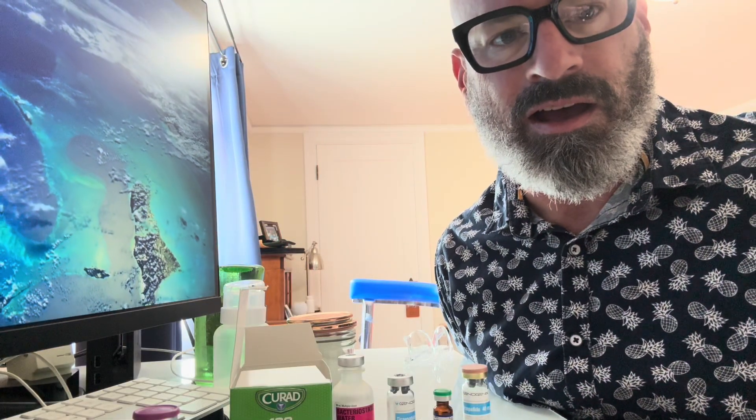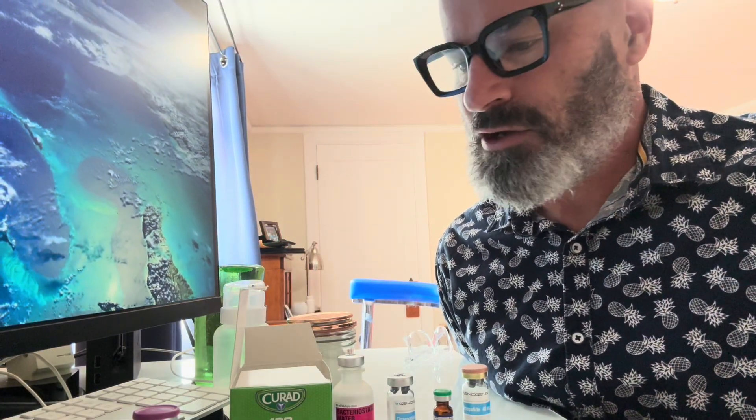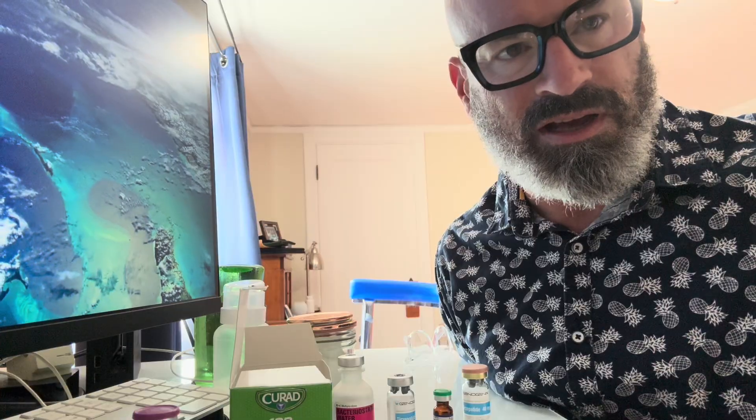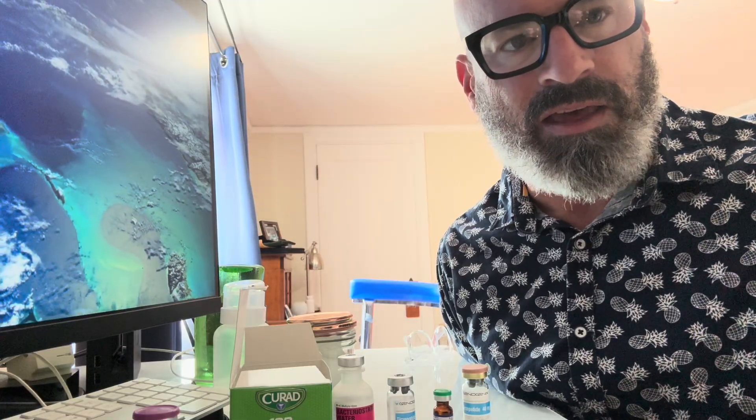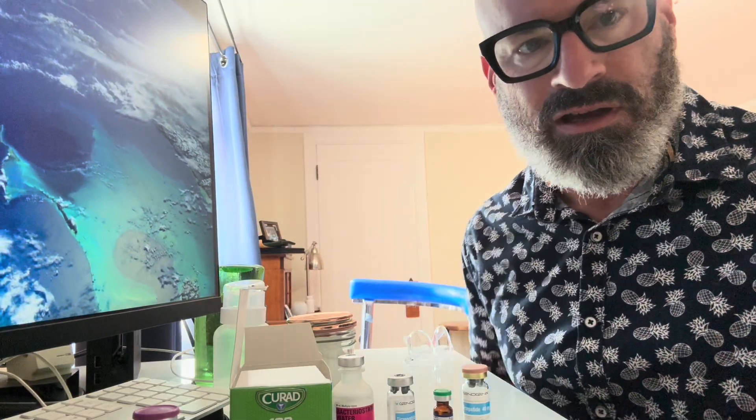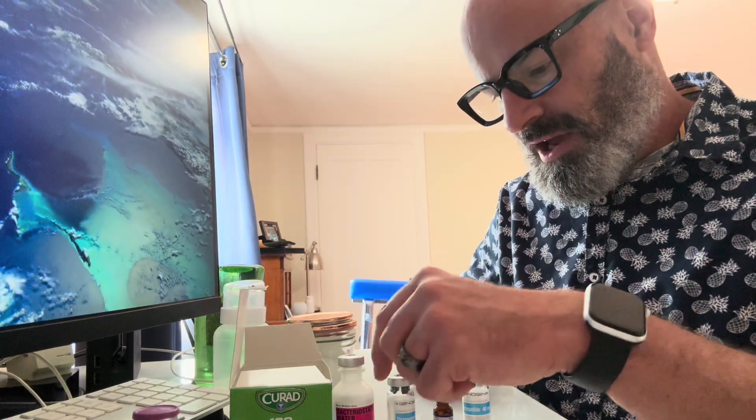Hey there, Dr. T in the lab. I had a few patients who had questions about reconstituting their peptides and I wanted to go through that simple procedure here real quick, starting off with some fresh supply.